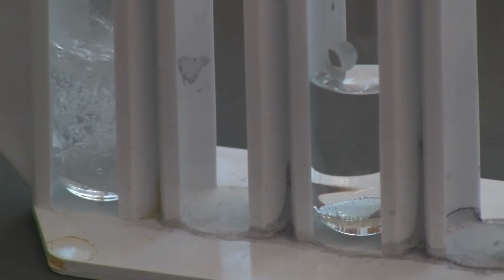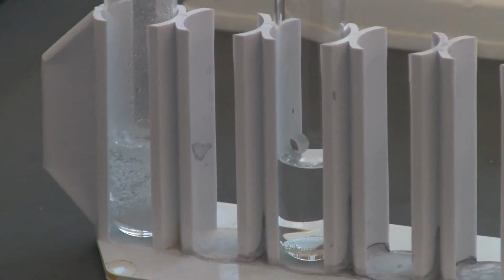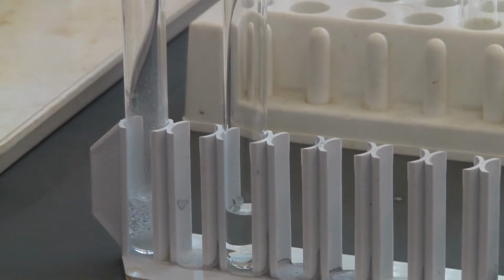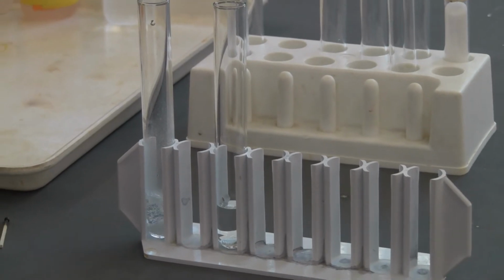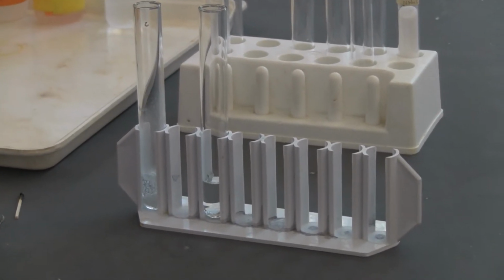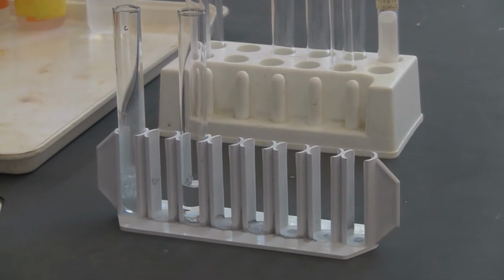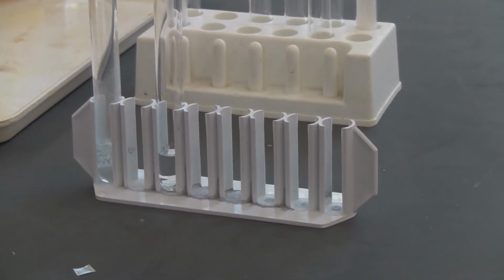You're going to identify which one is faster in question 2. In question 3, you're going to give a general trend. In this question, do not just repeat what you see. You are going to conclude from what you observed. Give a general trend about how the concentration influenced the reaction rate, in one sentence. Now let's study another factor of the reaction.